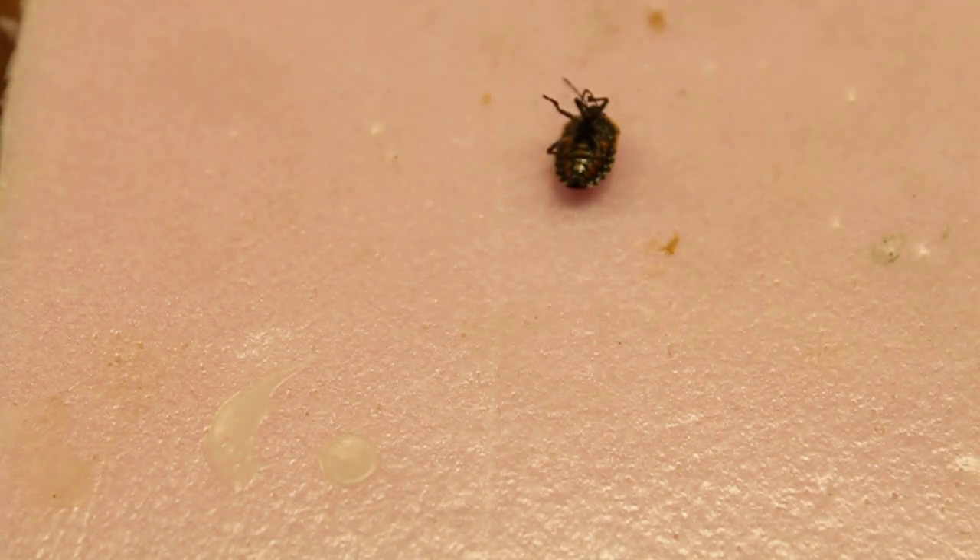So that's how you pin a moth, or at least that kind. We'll go to the next insect, which will be a true bug. I'll get the true bug — this one's a little smaller. I'll get some pins for this.